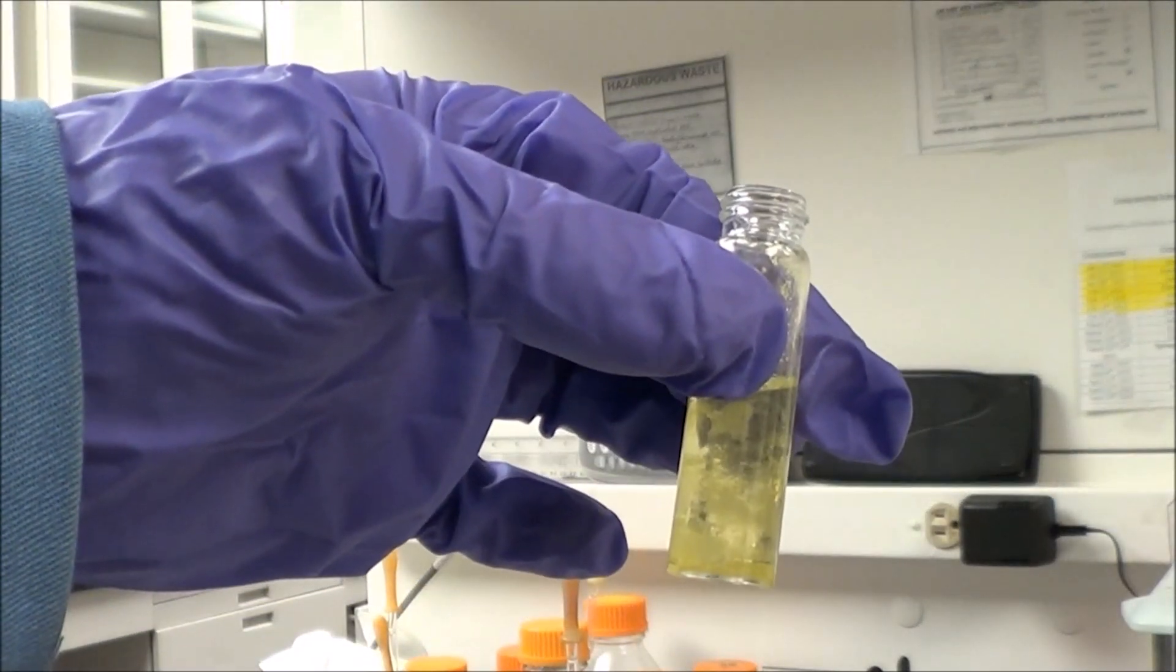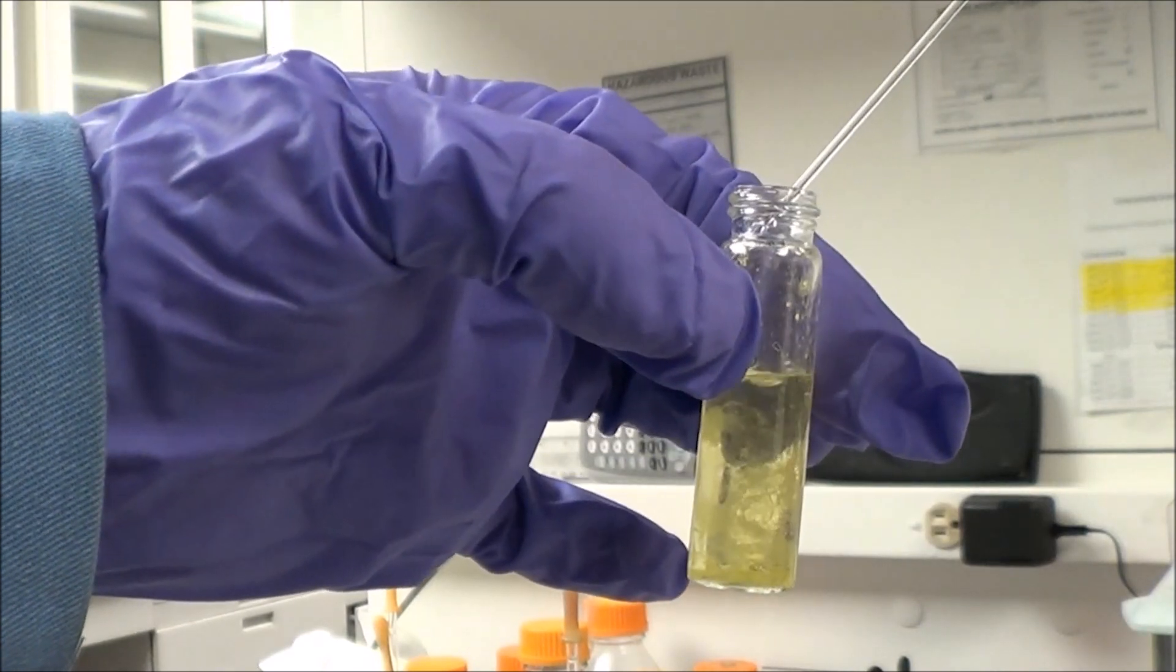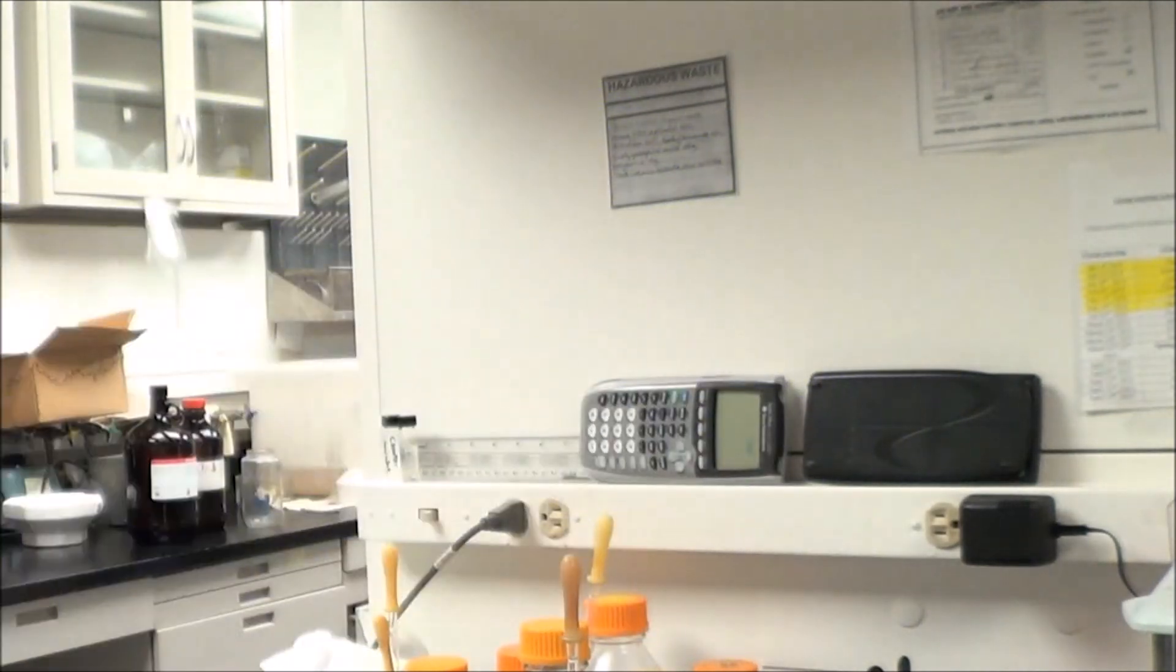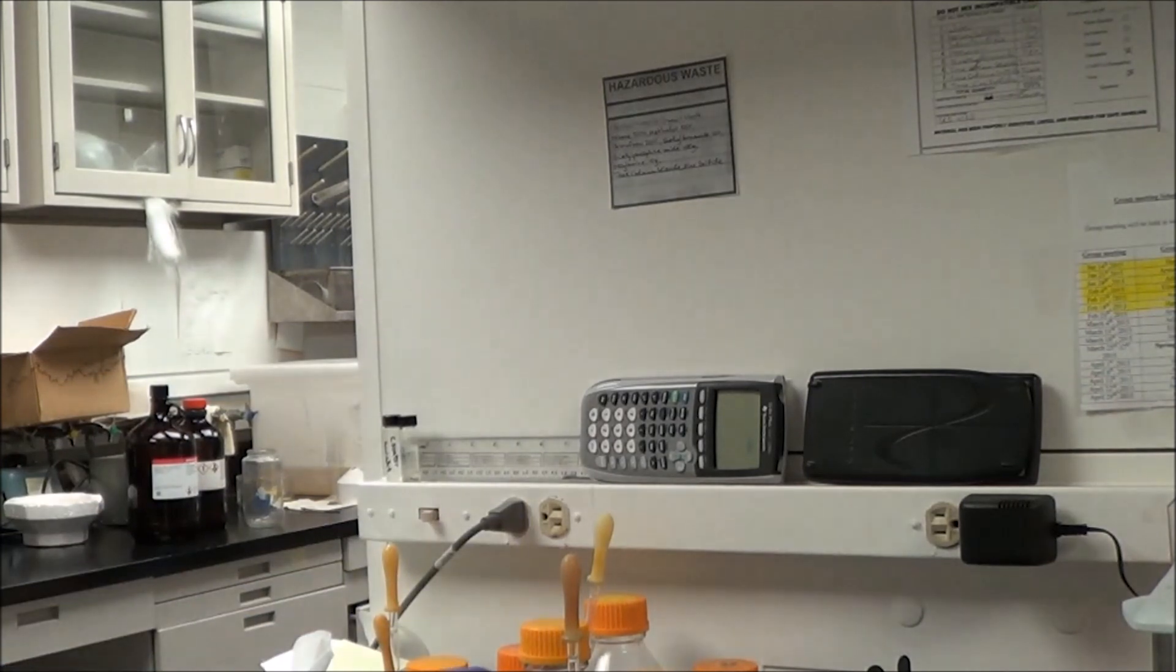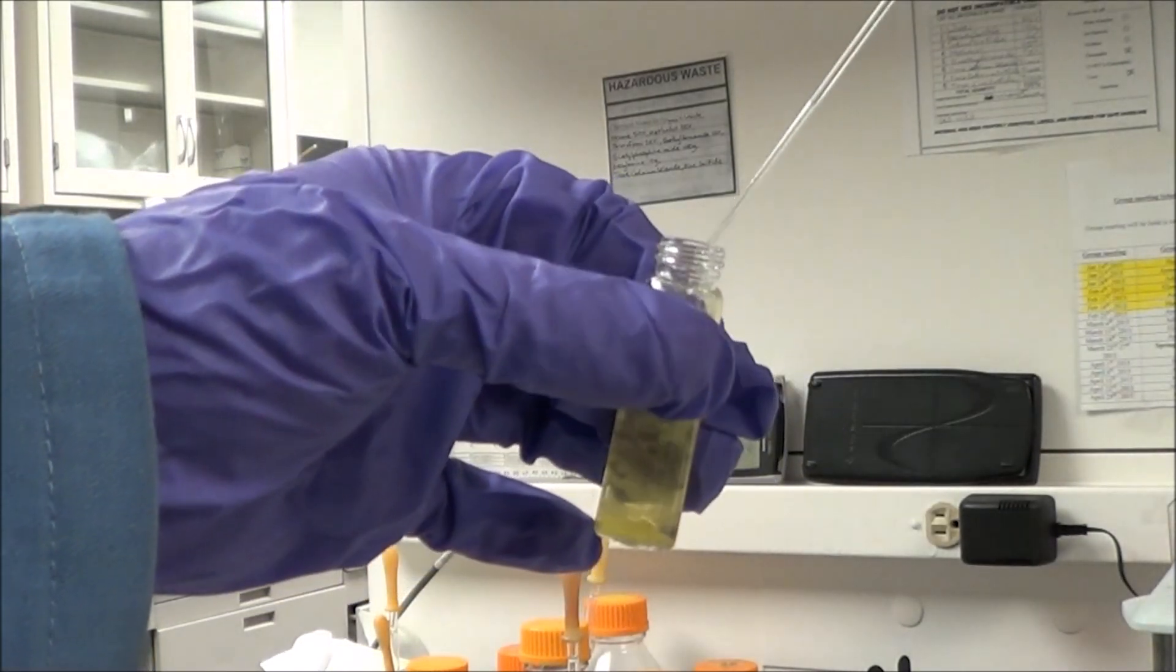Now this sample was a little bit slow to dissolve. Sometimes I'll sonicate the sample, usually just for a minute or two. If you have to do more than that, something's not right, and you're probably not going to get a good phase transfer yield.